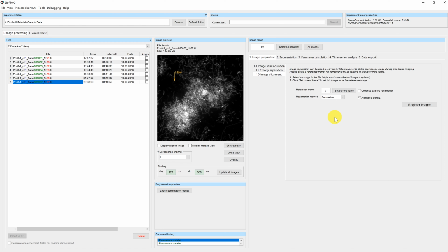The mean squares registration method uses the MATLAB internal approach for registering images. It is quite robust for small drifts, and the images don't have to be perfectly in focus. If you want to align your images also in Z direction, you can use this checkbox here. This alignment in Z will always use the correlation-based approach.